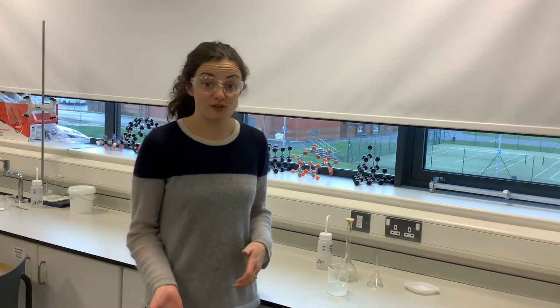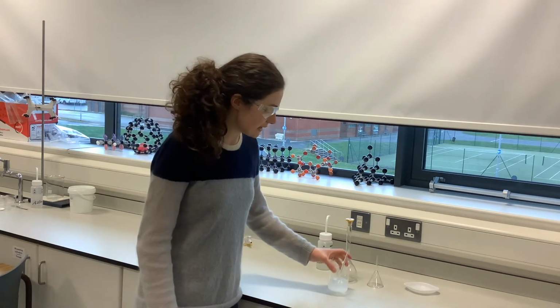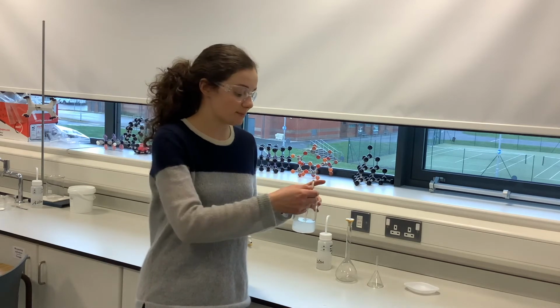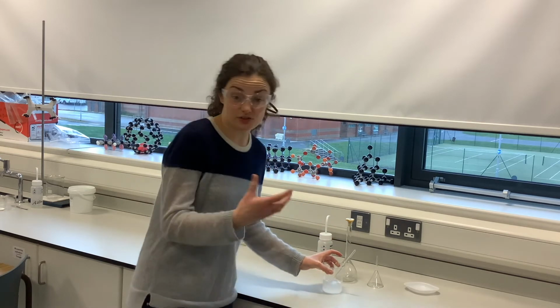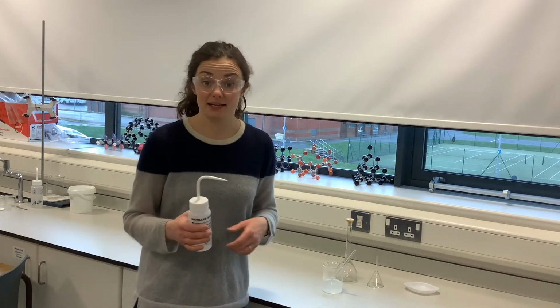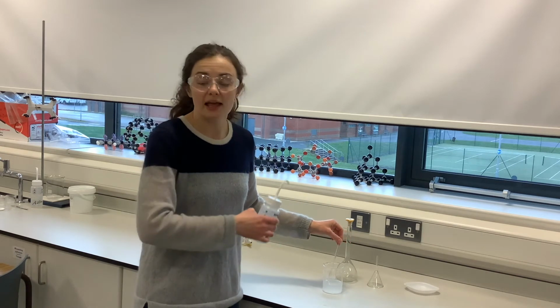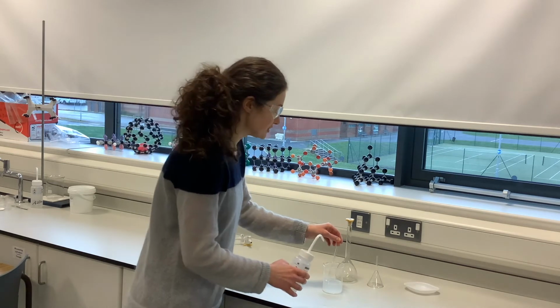Now that our salt has all dissolved, we want to make up our solution to an accurately known volume in our volumetric flask. So you'll see my salt has dissolved, but I have not removed my glass rod from my beaker yet, because remember, on that surface it has got some of the solution which will contain some of my dissolved salt. So as I remove it, what I want to do is get my deionized water and just rinse the glass rod so that all the solution that is on the glass rod is in with the rest of the solution in the beaker.